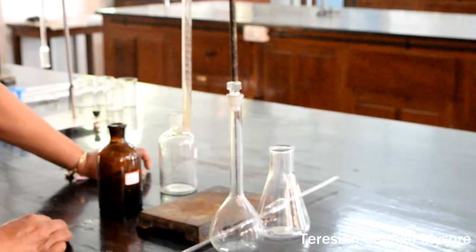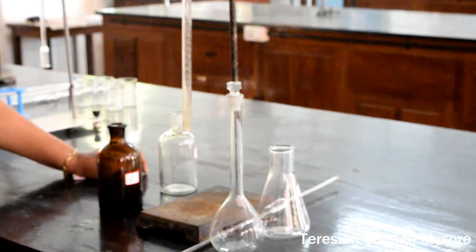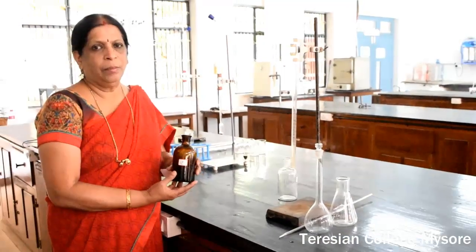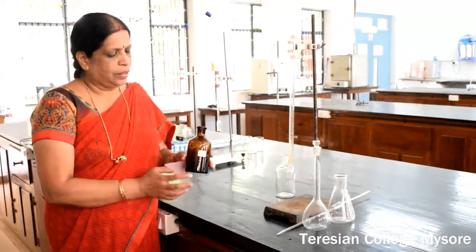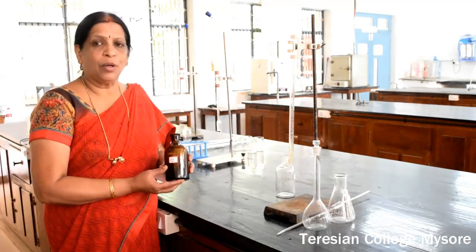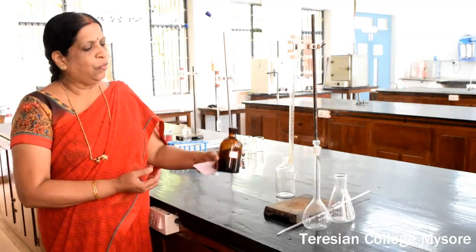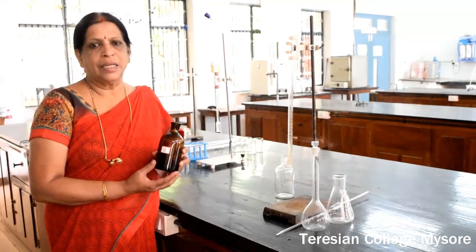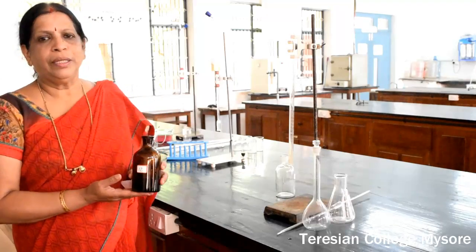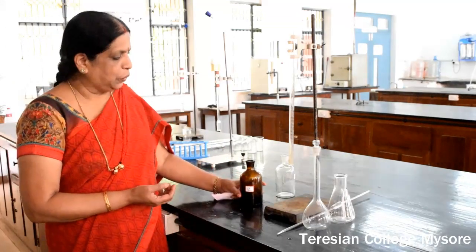In both cases, the first step is to standardize sodium hydroxide. Sodium hydroxide will be given in a brown bottle. A sufficient amount of sodium hydroxide whose normality is approximately 0.1 N is given to you. First you have to standardize this sodium hydroxide — meaning you have to find out the exact normality of sodium hydroxide that is supplied to you.